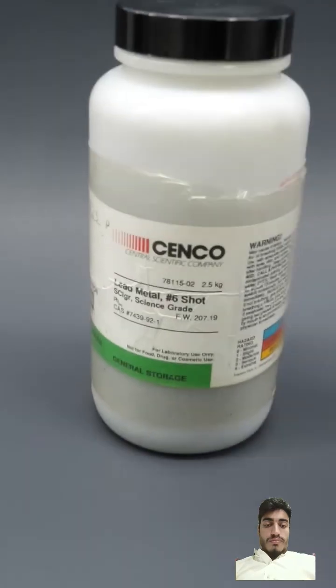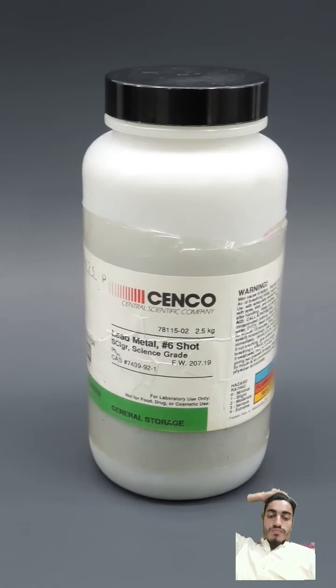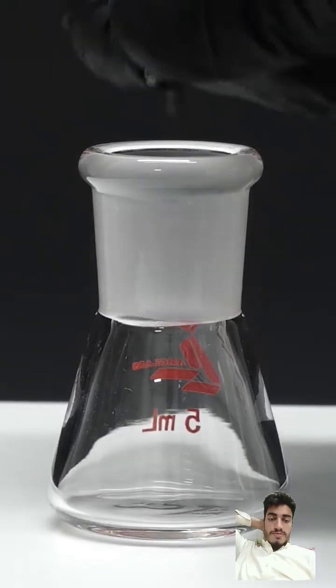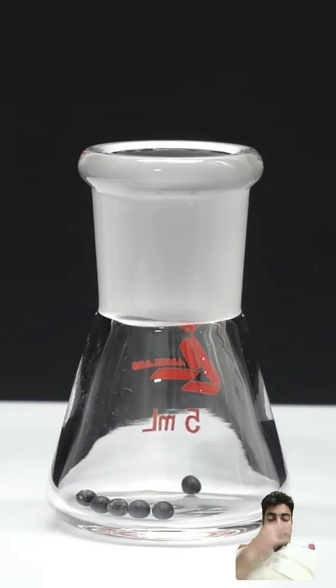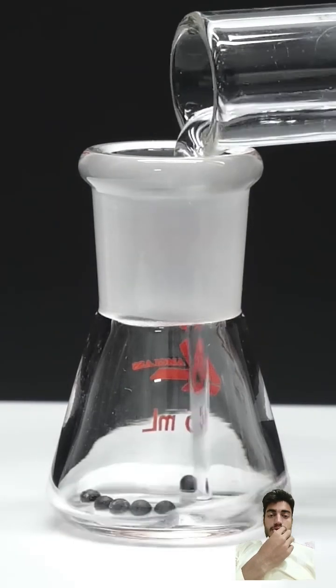Okay, so today, I've decided to try and turn some lead into gold. The first step is to get a few pieces of lead, and to add some dilute nitric acid.